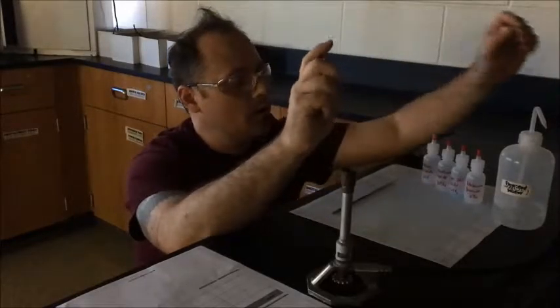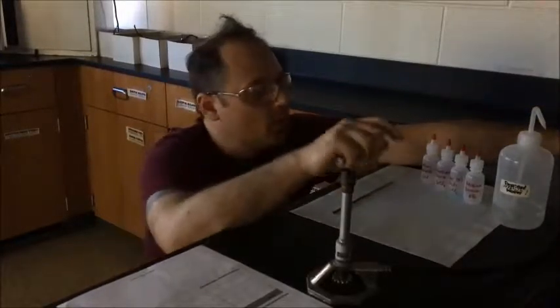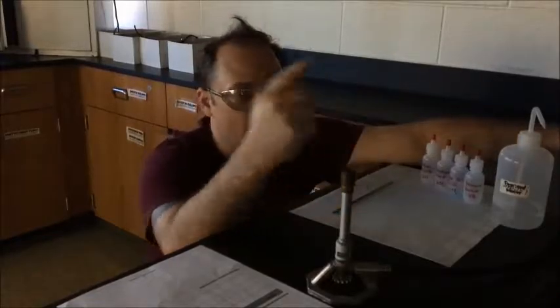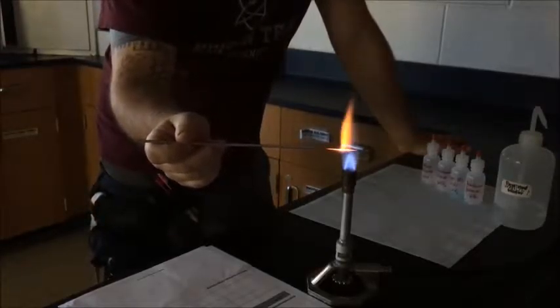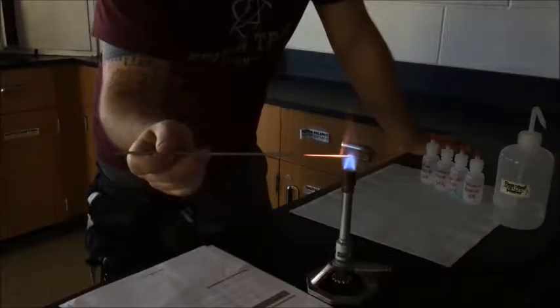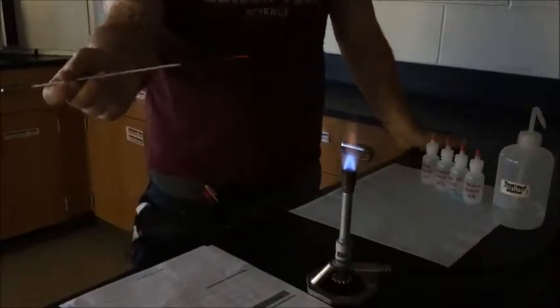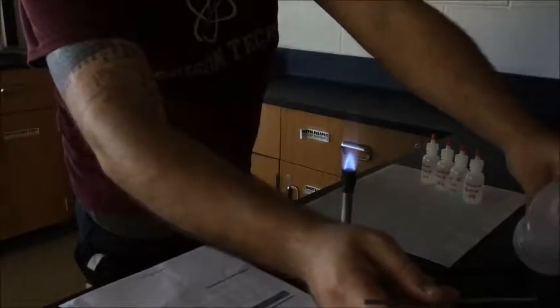Alright, I'm back. And now I'm going to show you how to do this procedure for the known chemicals. I'm going to use a different chemical that is not one of the knowns, so you can't get a result from your lab just by watching the video. I'm going to use a different one called barium chloride. The first thing I do is I turn on my gas. I can hear it. Light it on fire. I want a nice, small but hot flame. Low heat, small tip, small flame. The first thing you want to do is clean off your loop. Maybe there's some fingerprints on there. Heat it up until it's red-orange. Note, this orange color is the color that the loop burns by itself. That is not the color that we're looking to report in our report. Let it cool down for a second. Take your squirt bottle and into the sink, give it a good squirt, a good rinse, and there it goes.